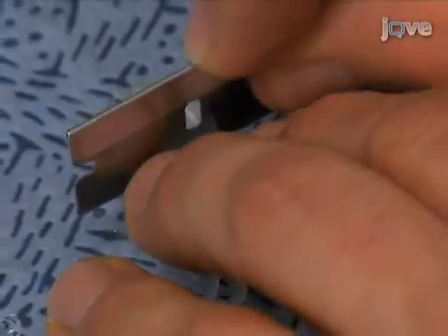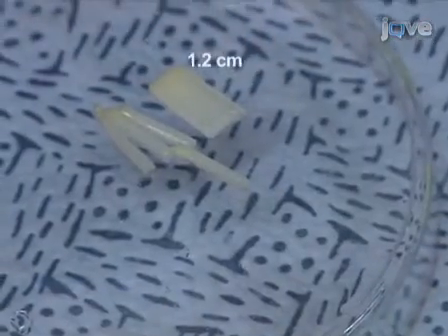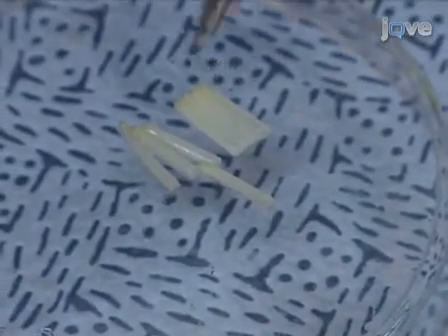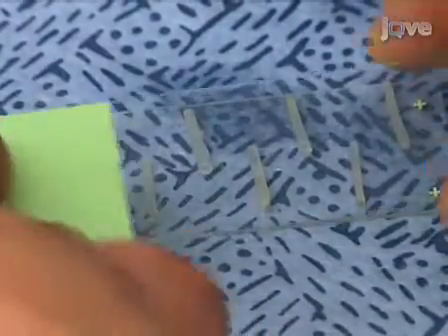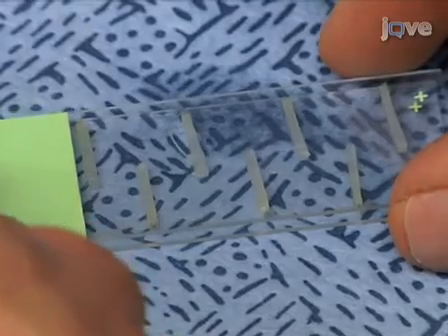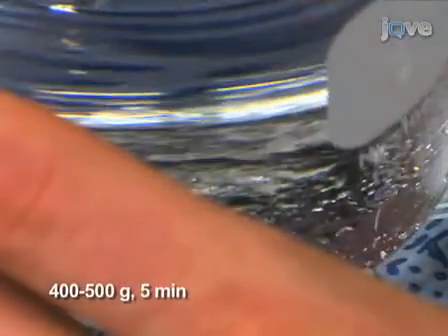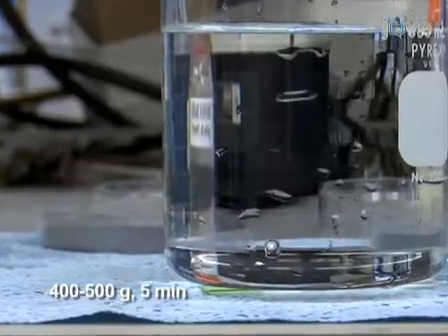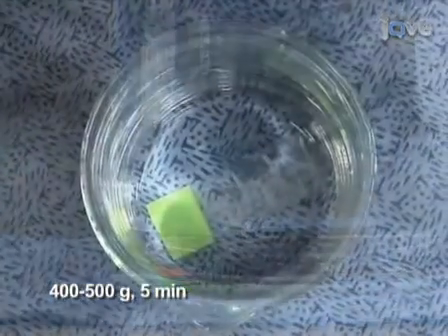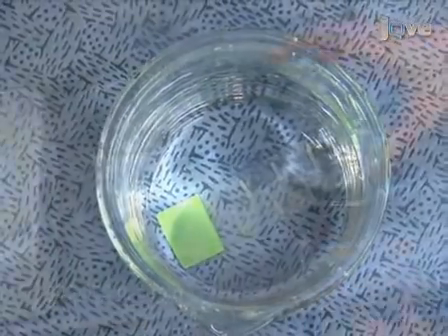Following cuticle removal on all seedlings, they are cut to the desired length, usually 1.2 centimeters, with a new single-edge razor blade and then aligned on a glass slide. After alignment, a second glass slide is placed on top of the group of 8 to 10 samples and a weight, 400 to 500 grams, is placed on top of the glass slide for 5 minutes. We typically use a beaker filled with a suitable amount of water. The weight of the beaker will flatten the cell walls to remove cell sap and to facilitate clamping.